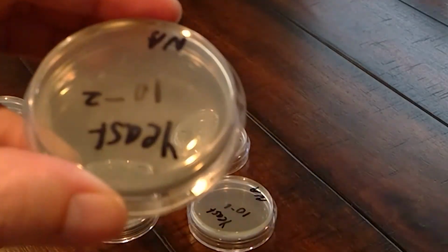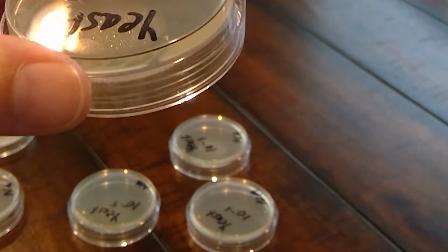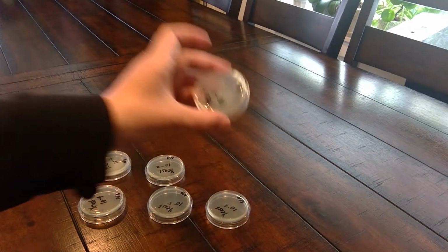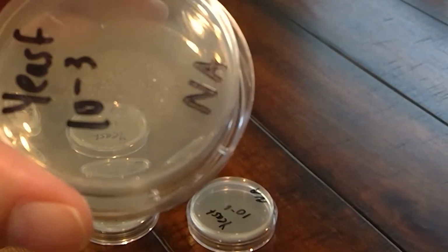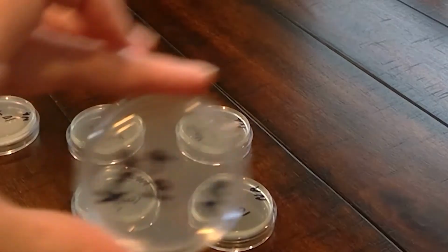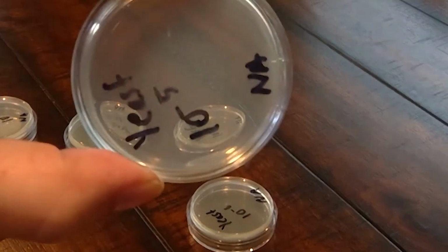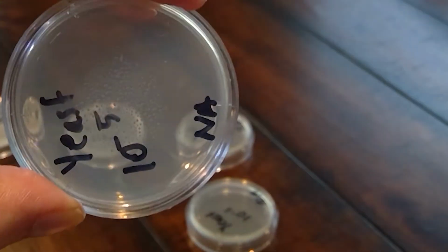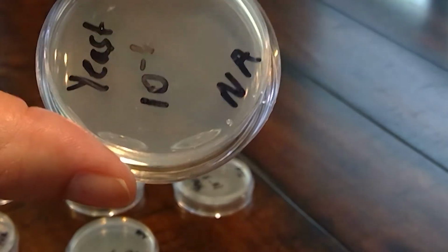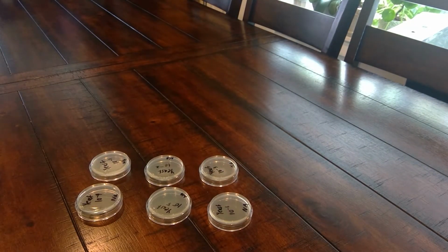And then on the second plate, I don't even really see the cloudiness that I saw in the first plate. And so all of these don't seem to be growing much. So I don't know if it was an issue with our yeast or an issue because of the temperature. So I'm going to let these grow for a couple more days, and then we will look at the results again.